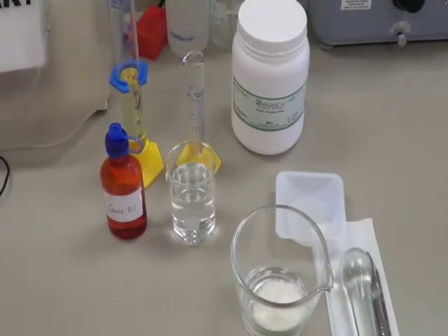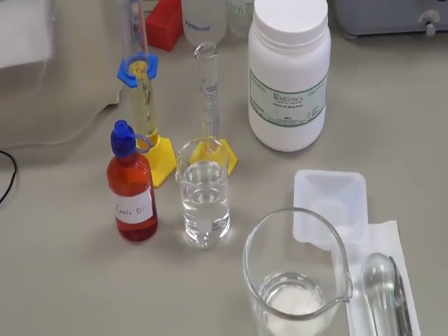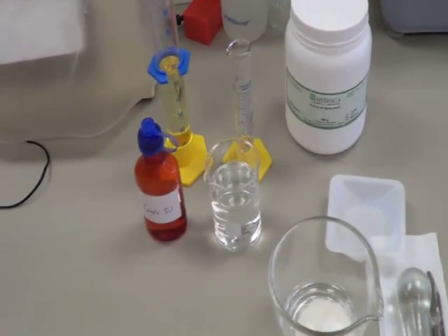Welcome back guys. Today we are going to compound an emulsion, and for this we are going to use a dry gum method.